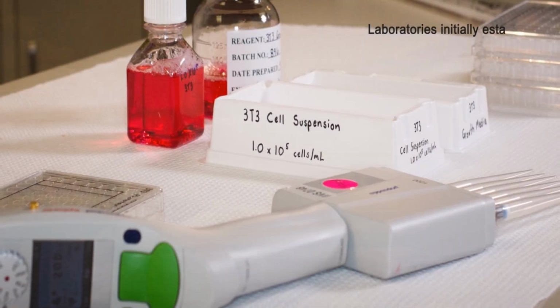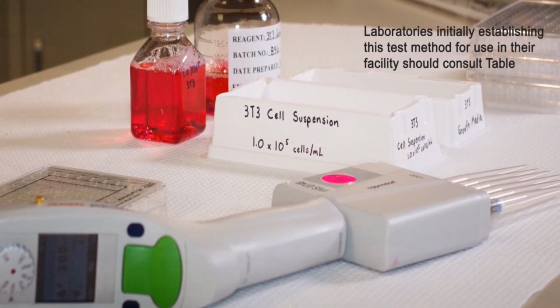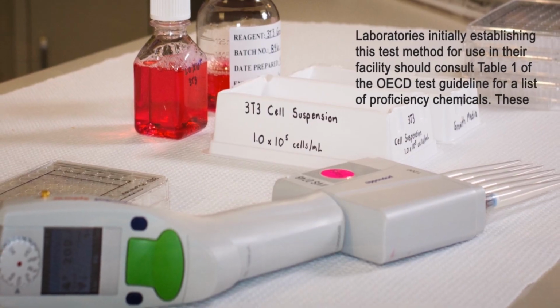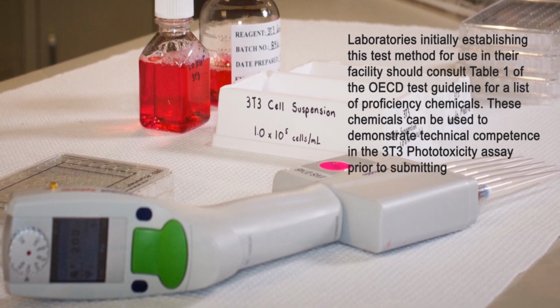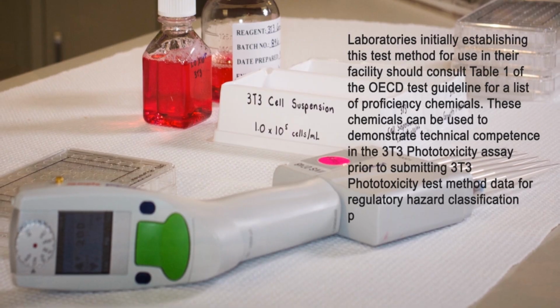Laboratories initially establishing this test method for use in their facility should consult Table 1 of the OECD test guideline for a list of proficiency chemicals. These chemicals can be used to demonstrate technical competence in the 3T3 phototoxicity assay prior to submitting 3T3 phototoxicity test method data for regulatory hazard classification purposes.